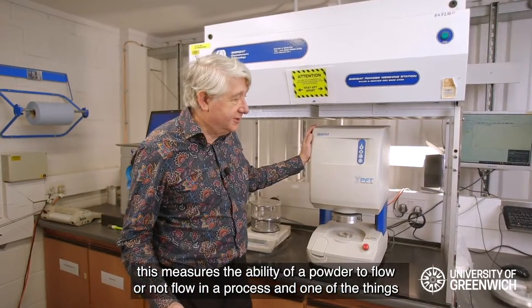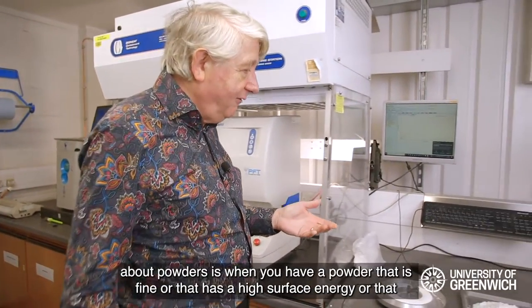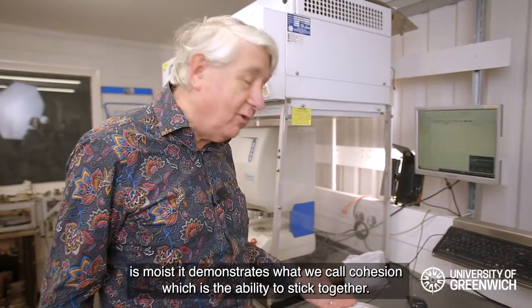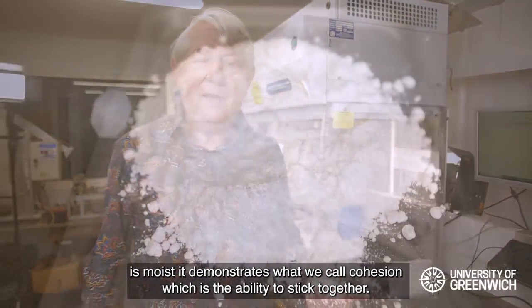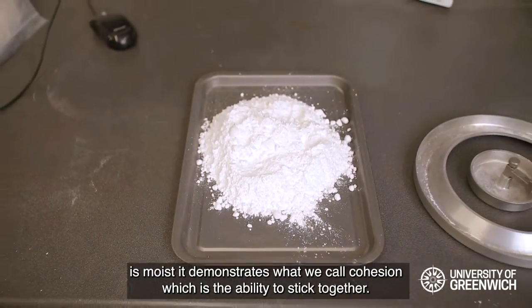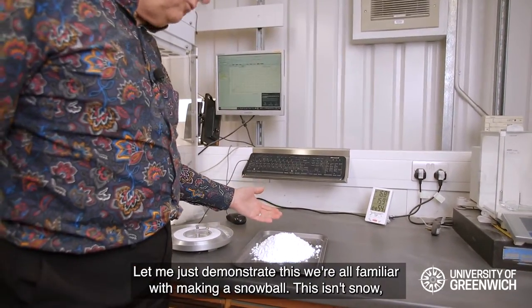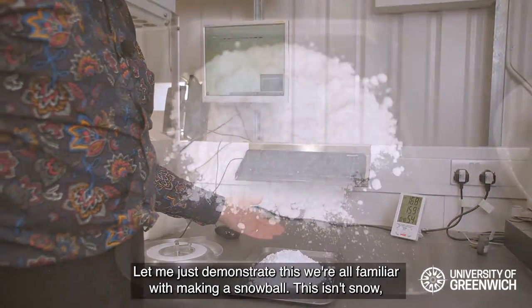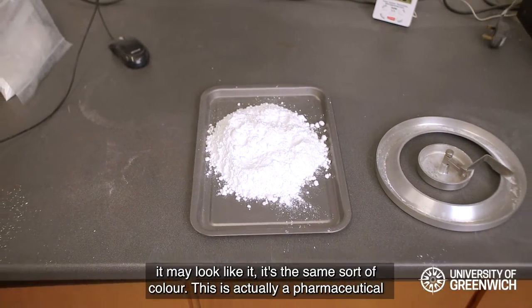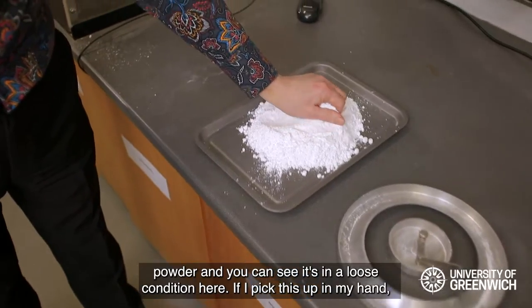One of the things about powders is that when you have a powder that is fine, or has a high surface energy, or is moist, it demonstrates what we call cohesion — the ability to stick together. Let me demonstrate this. We're all familiar with making a snowball. This isn't snow — it may look like it, same sort of color — but this is actually a pharmaceutical powder, and you can see it's in a loose condition here.